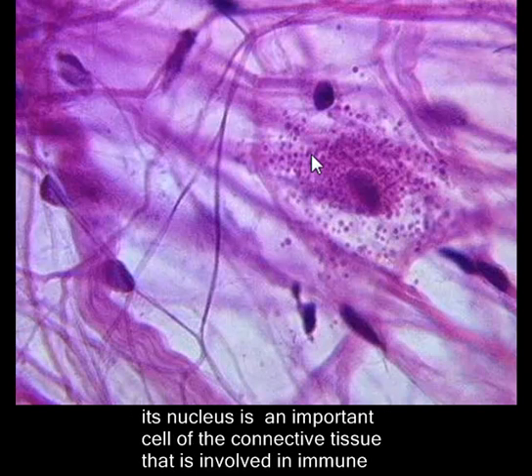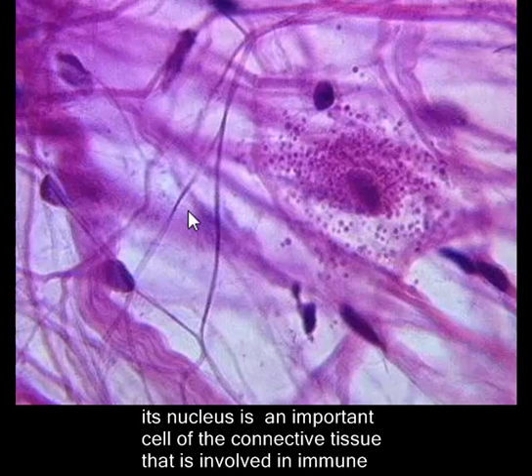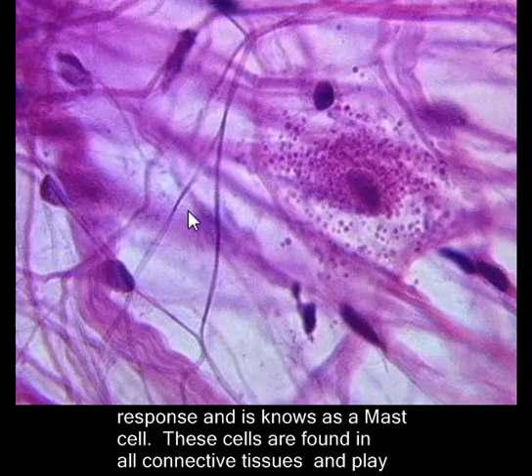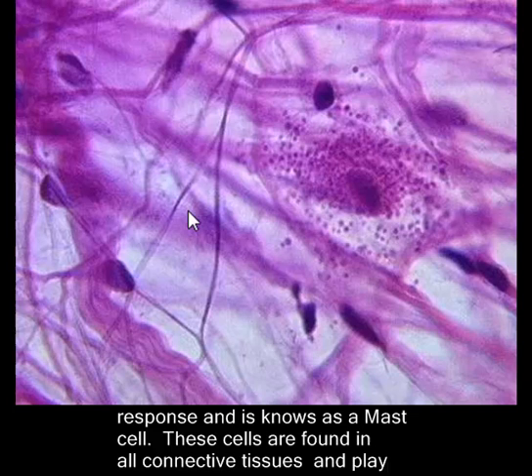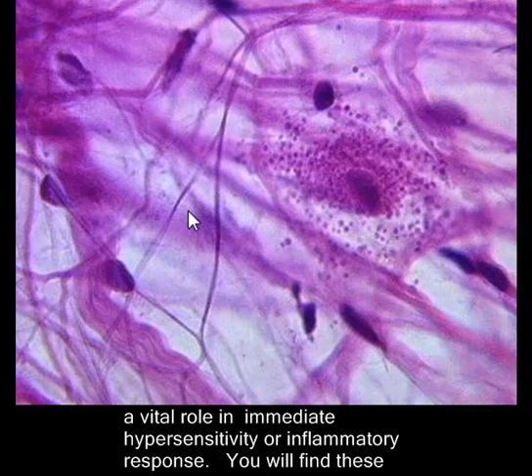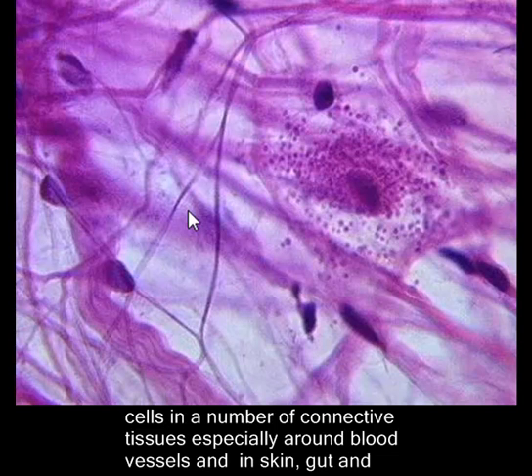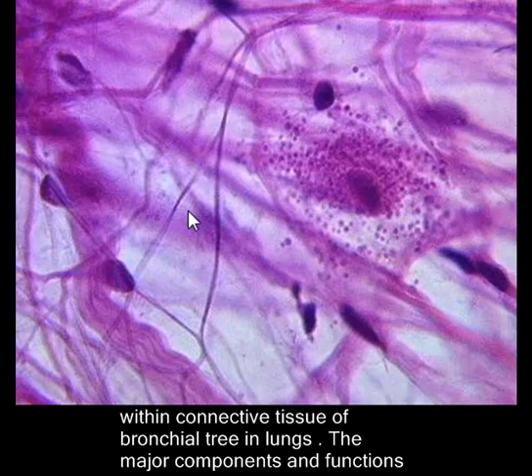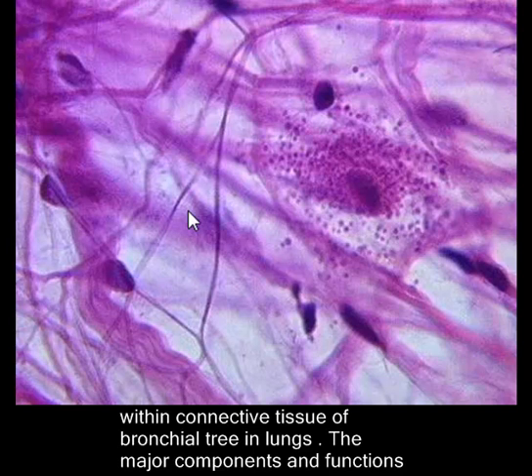The most prominent cell in this slide is the one that has granules around its nucleus. It is an important cell of connective tissue involved in immune response and is known as a mast cell. These cells are found in all connective tissues and play a vital role in immediate hypersensitivity or inflammatory response. They are found especially around blood vessels in skin, gut, and within the connective tissue of the bronchial tree in lungs.